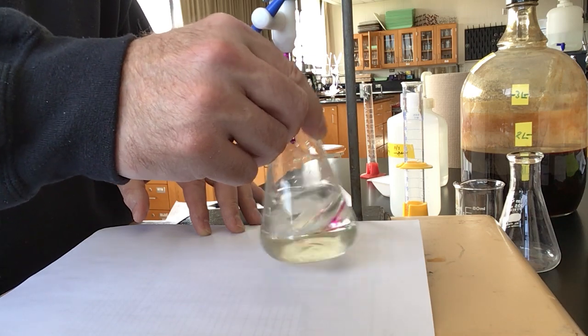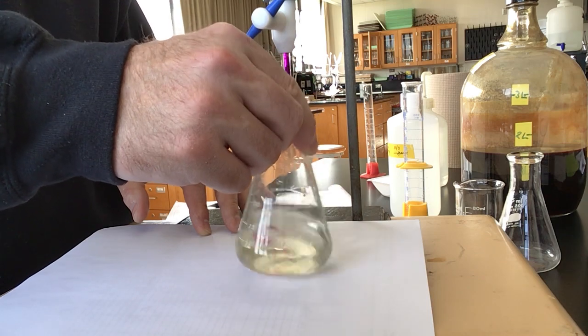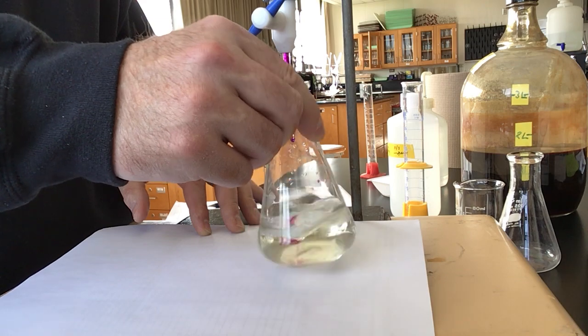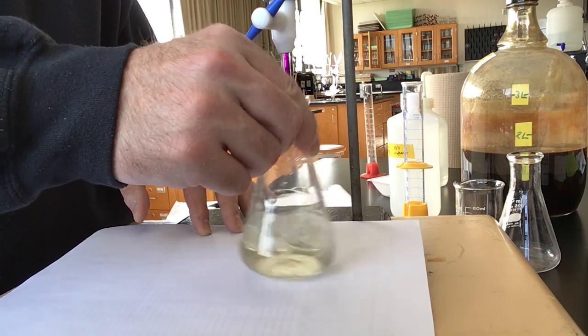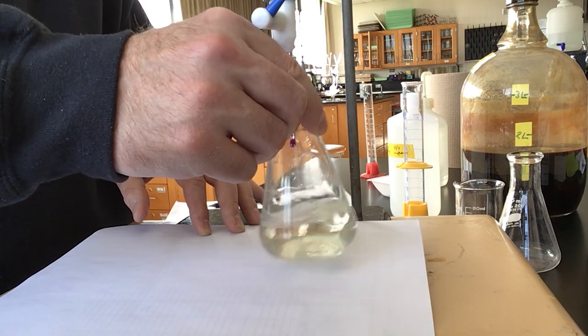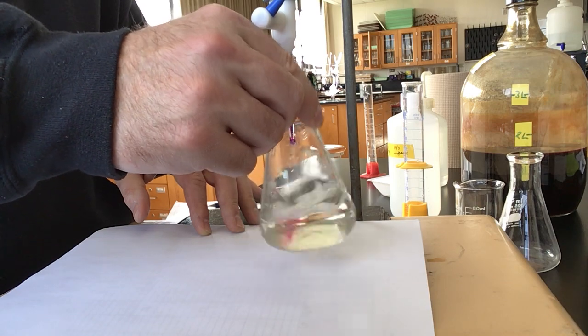You would need to know the chemical reaction to be able to figure that out. So that might be something that's given, or you could look it up. Seems like it's lingering a bit longer now, getting pretty close to the endpoint.